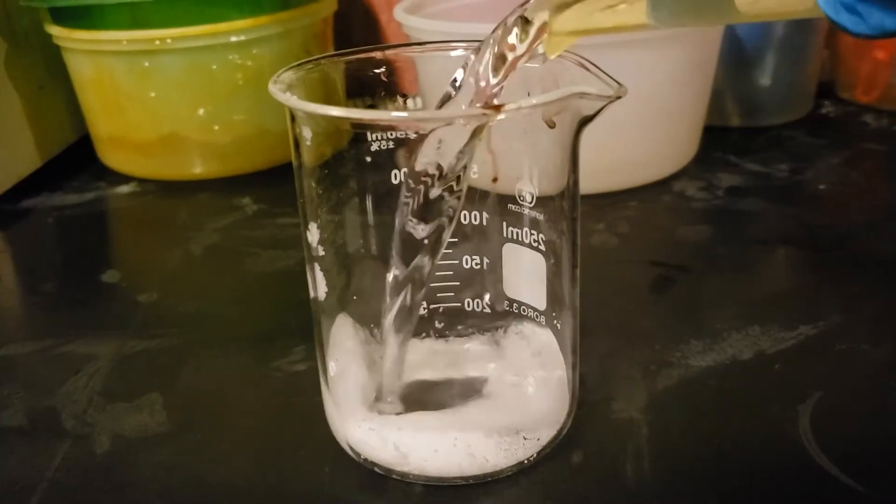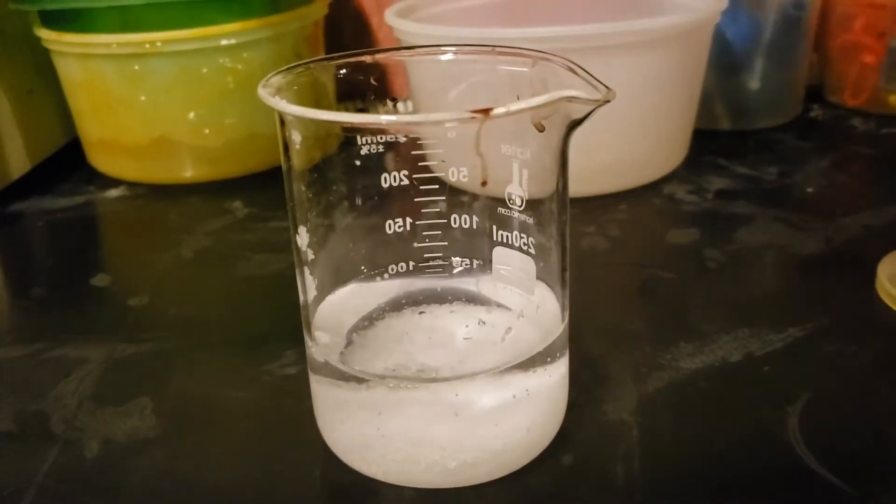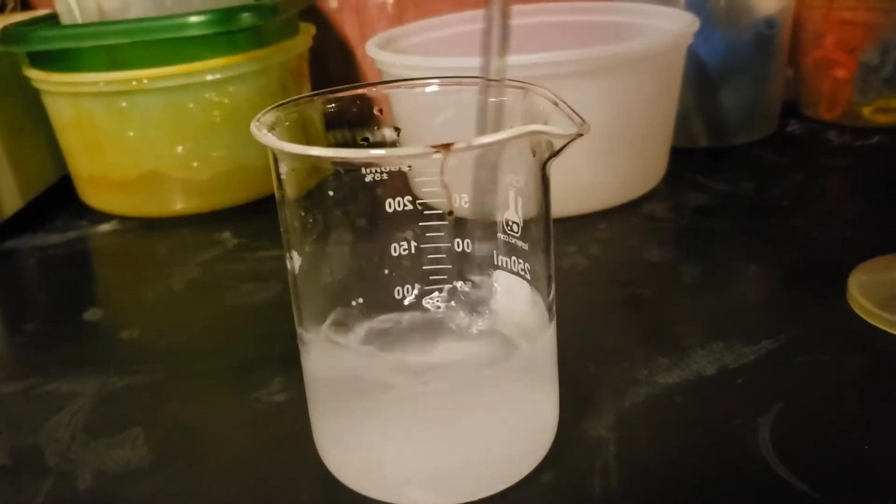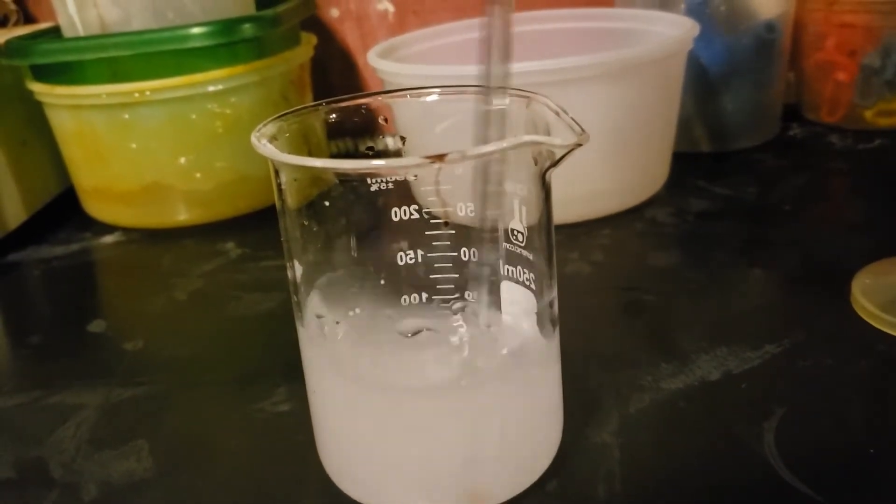Meanwhile, a 10% sodium hydroxide solution was prepared. I elected to prepare 100 milliliters of it. I didn't end up using all of it in the workup, which you will see in a minute.